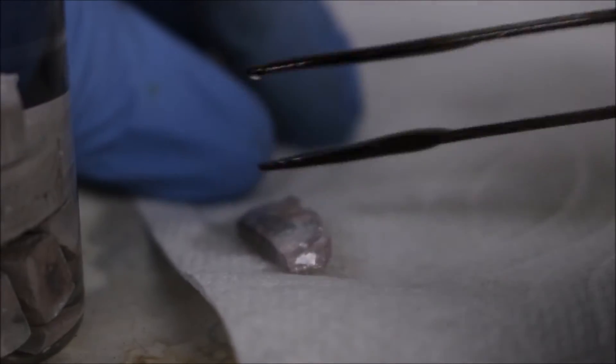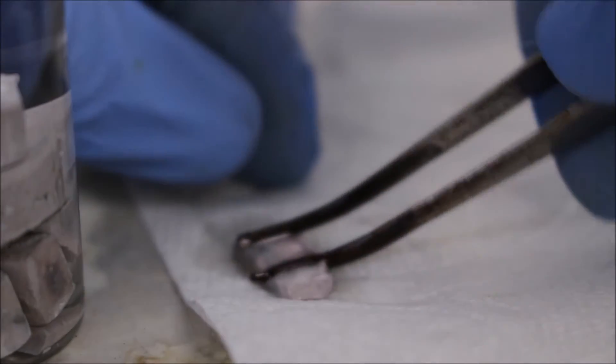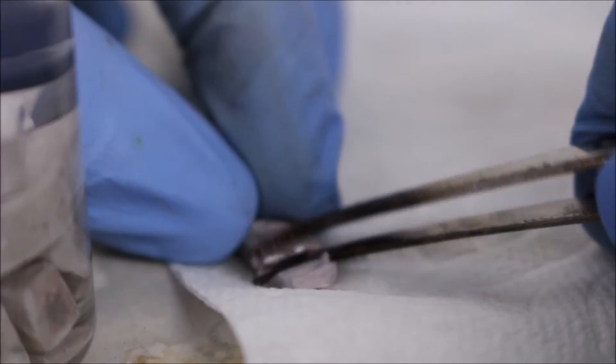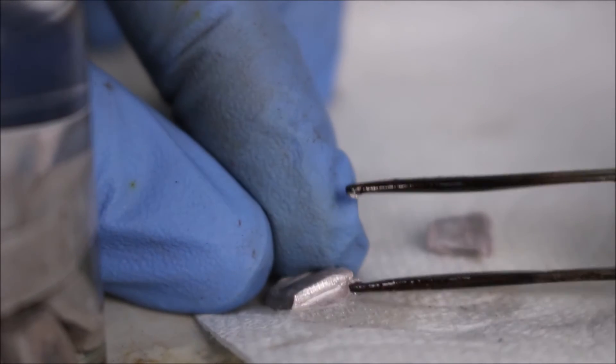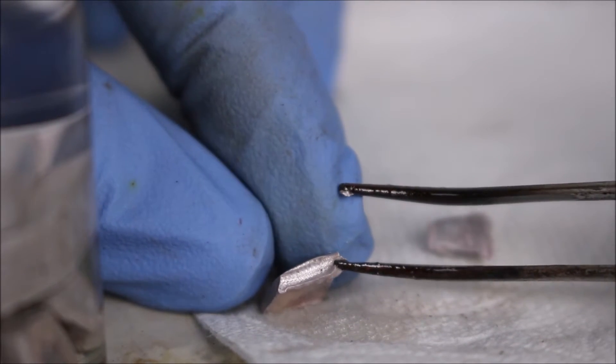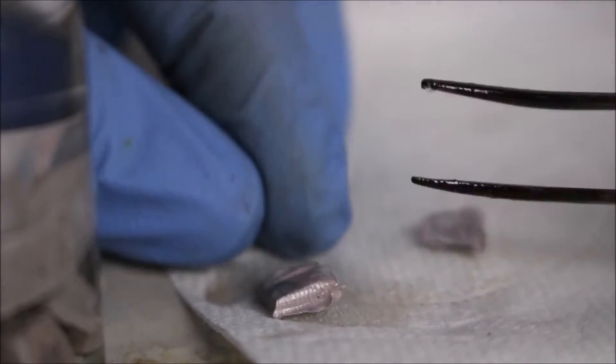Here's the sodium metal, see if we can cut into it a little, to see the surface. Wow. It's not that tarnished. Very nice. There's the silvery surface of unoxidized sodium.